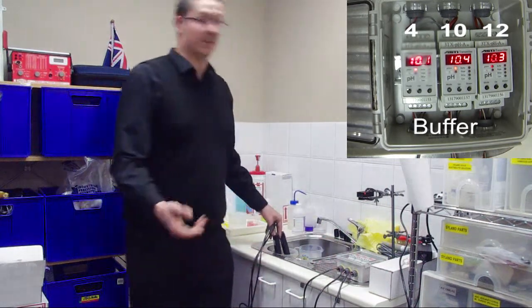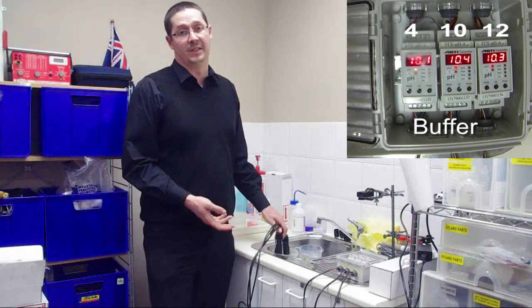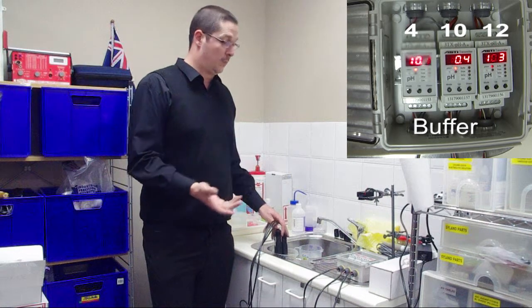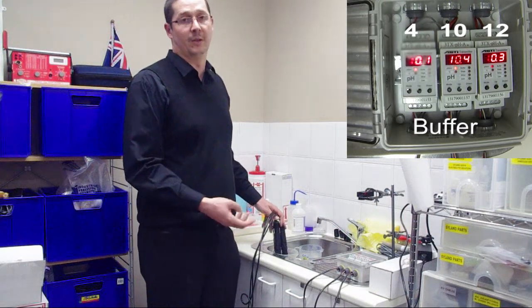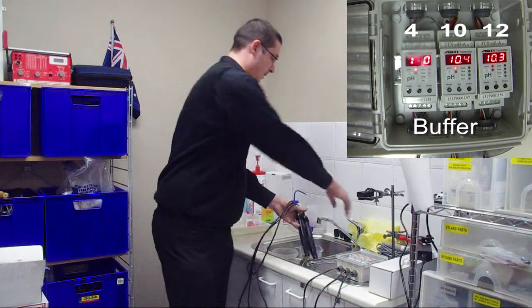As you can see, all of these numbers are quite different depending on what we've calibrated to. There's a simple calibration error based off of the way that a pH sensor operates. And one of the things you want to try and do is avoid calibration errors by calibrating as close to the target pH that you're looking for. Now let's have a look at the acidic solution.